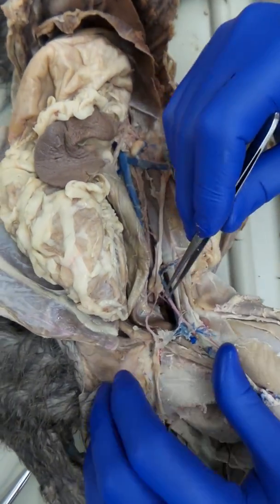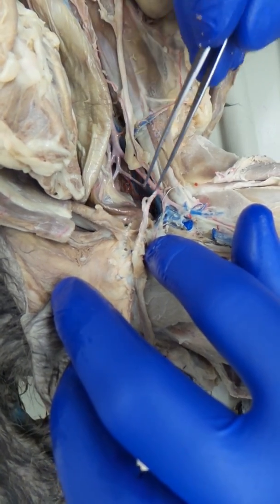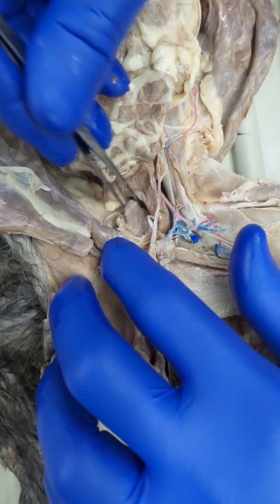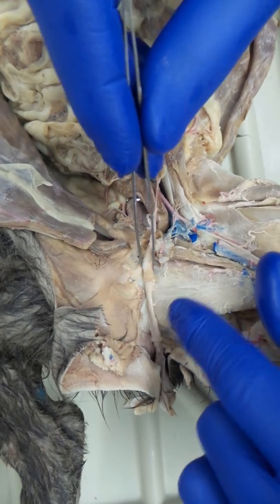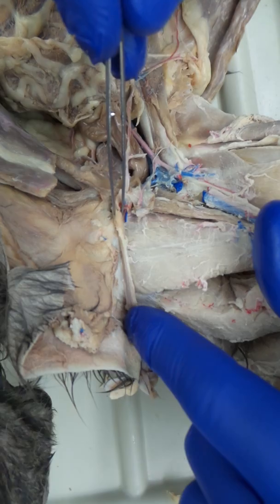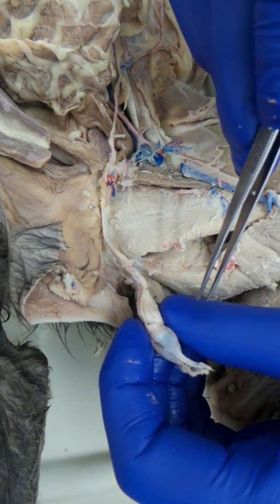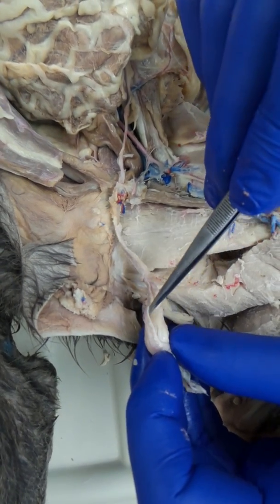As far as the organs go, some structures you need to know. This is a male cat. Right here is the spermatic cord, and this is the vas deferens. This is the urinary bladder, and here we can see the vas deferens again on the other side. This conduit here that's carrying the vessels and the vas deferens down to the testis is the spermatic cord — you need to be able to identify that. And then the testis itself — I've removed one of the membranes, that's the tunica vaginalis. Under that you have the testis itself, and then this structure right here is the epididymis.